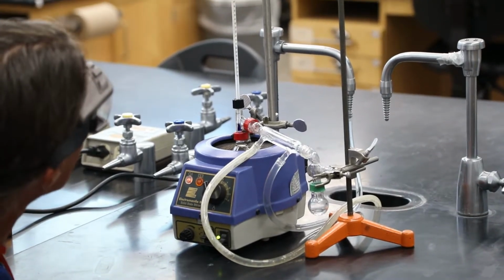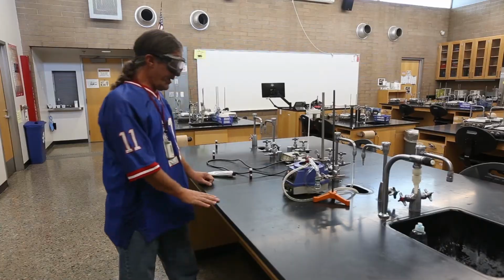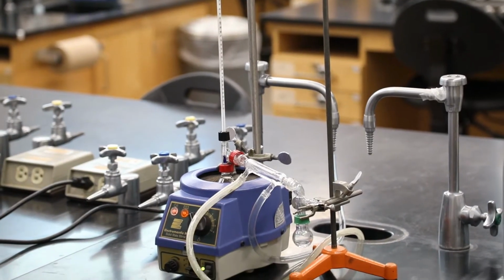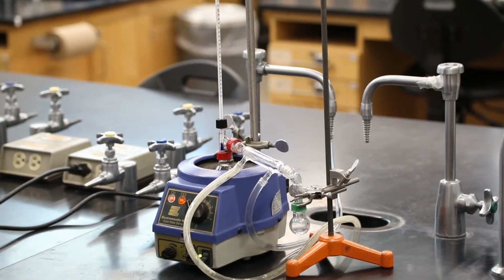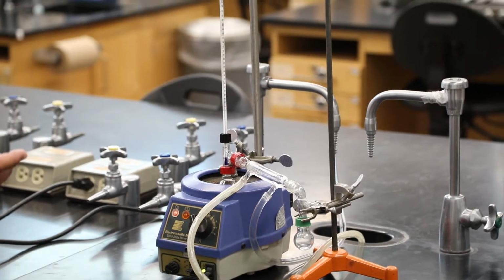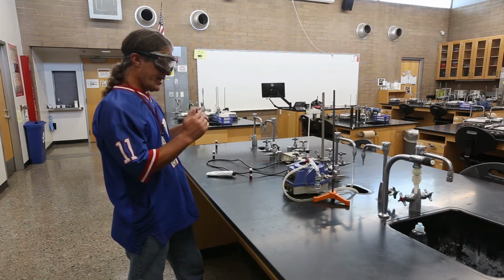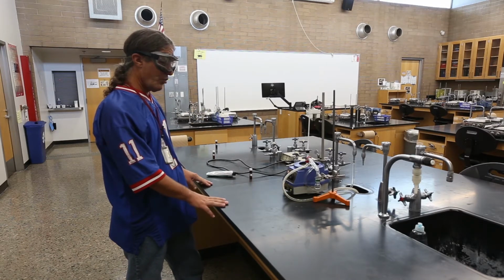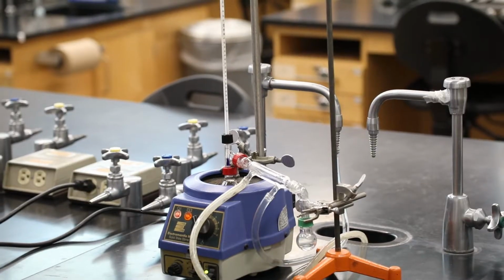And it's all at the constant temperature of 66 degrees. Now, if we're at atmospheric pressure, that would be the normal boiling point of hexane. Since our pressure is probably a little different, we're going to look up the boiling point of hexane, compare, and see how much different today's boiling conditions are than the normal boiling conditions.